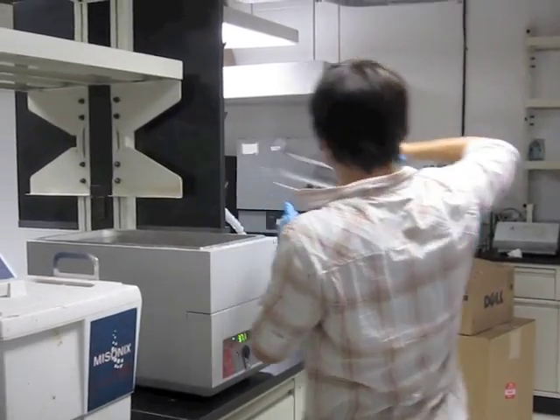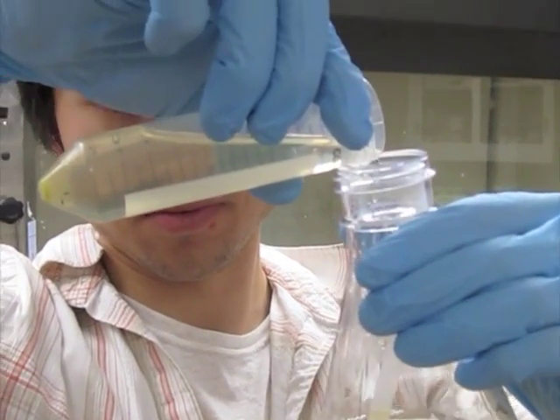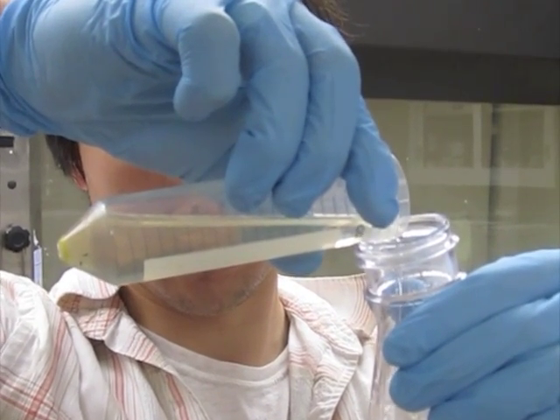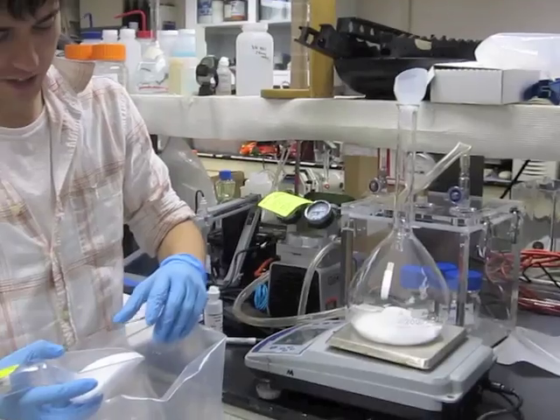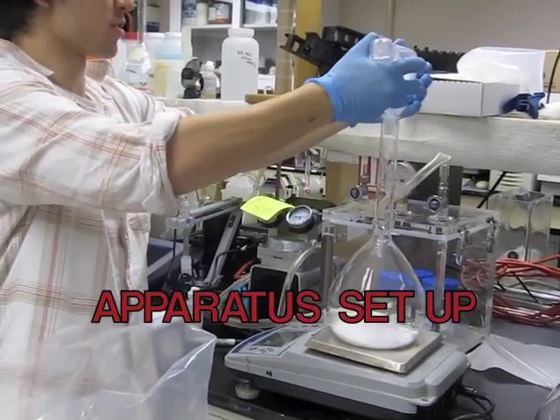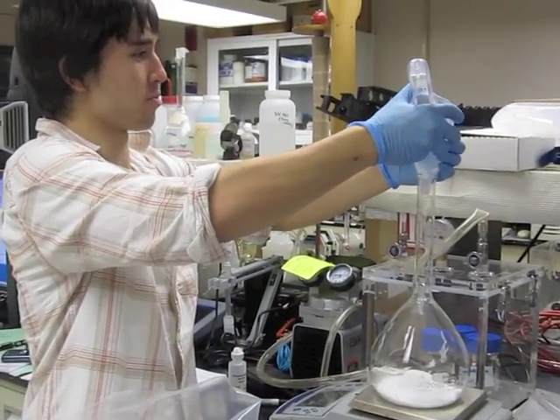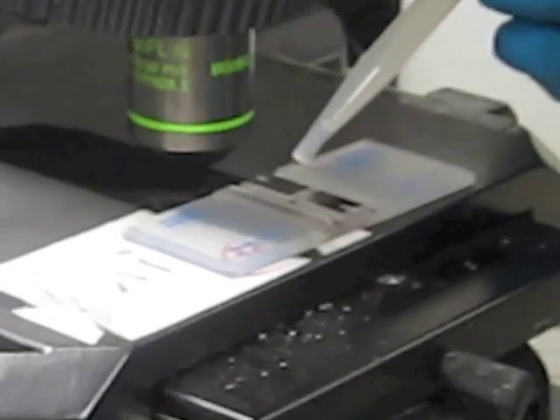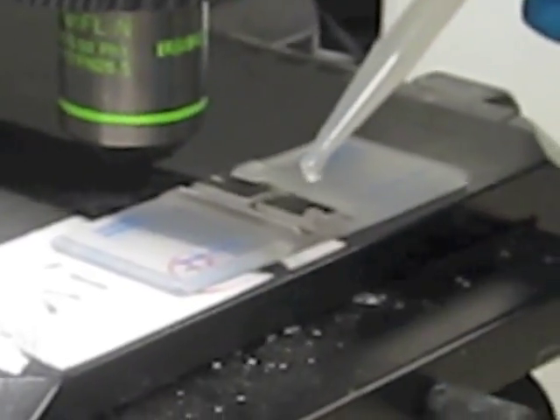After 6 hours, we used a centrifuge to systematically replace the LB broth with 154 millimolar sodium chloride solution to make the bacteria more visible. Meanwhile, we also prepared 4 molar for the draw solution and 100 millimolar for the feed solution. Once the LB broth was replaced, we determined the amount of bacteria in the solution under a microscope using image analysis.